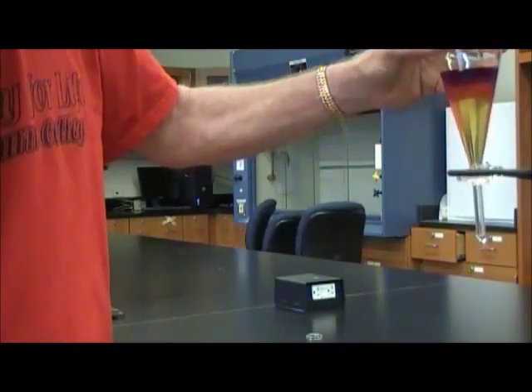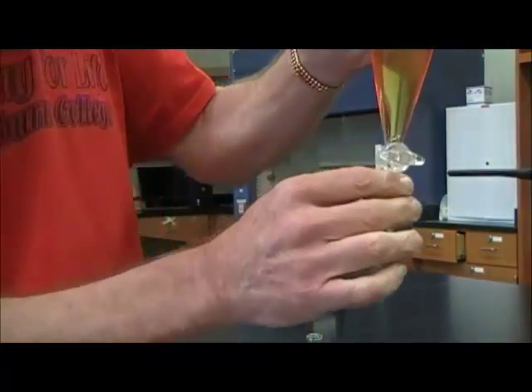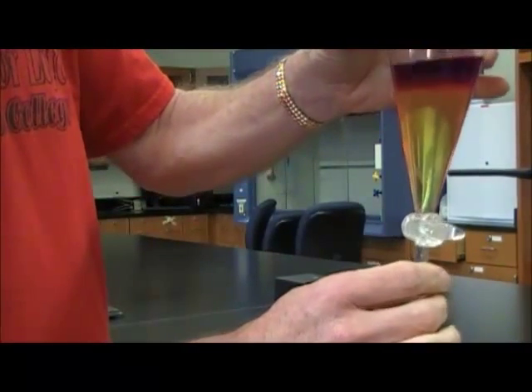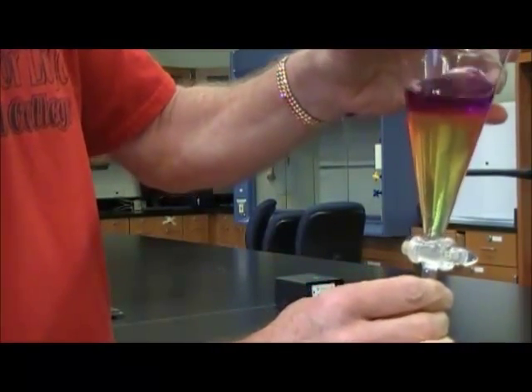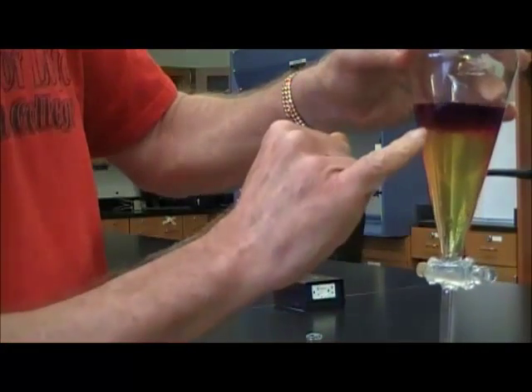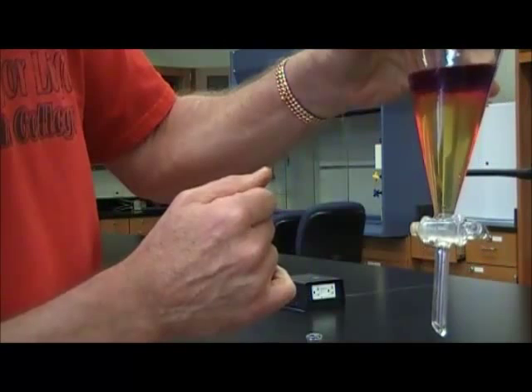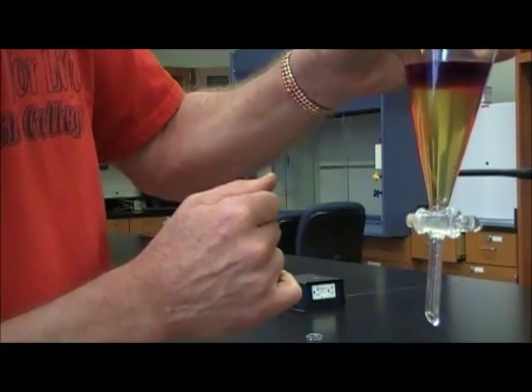I'm going to let it sit for a few minutes because you will notice that there's still some bubbles in between. The boundary between the top and the bottom layer is a little bit fuzzy, and there's some bubbly material there. That's what's called an emulsion. That happens occasionally, and it'll eventually disappear. You just have to be patient.